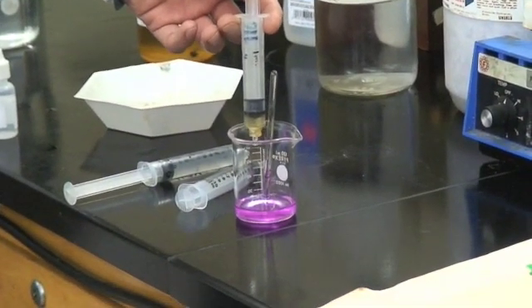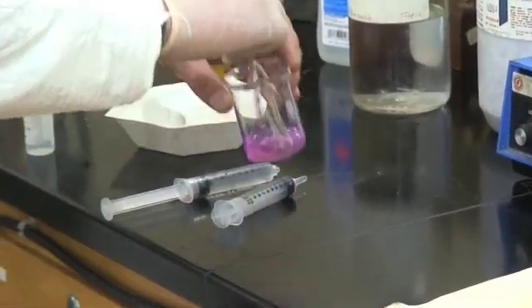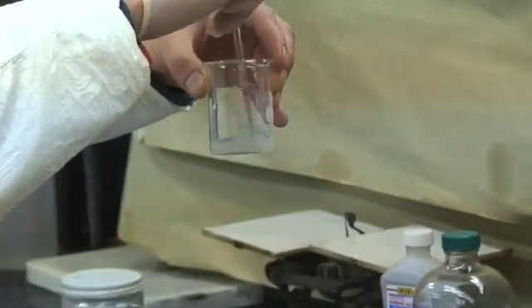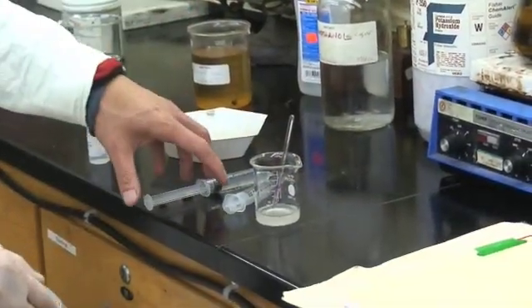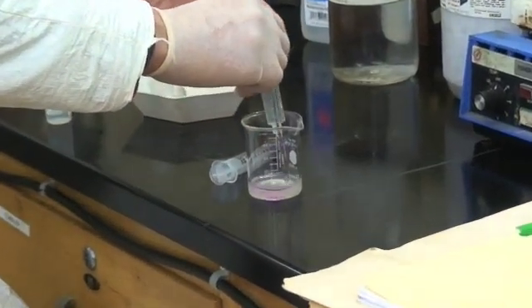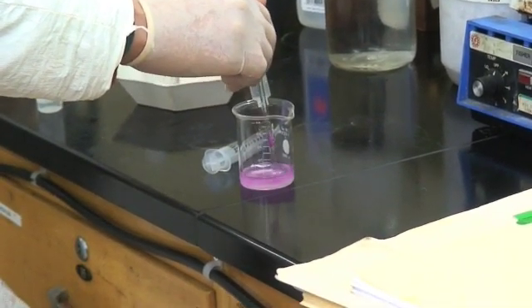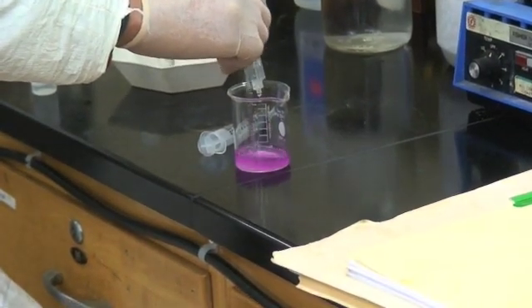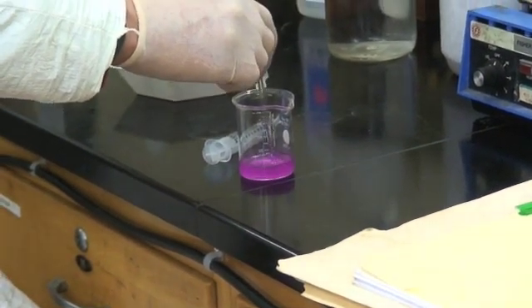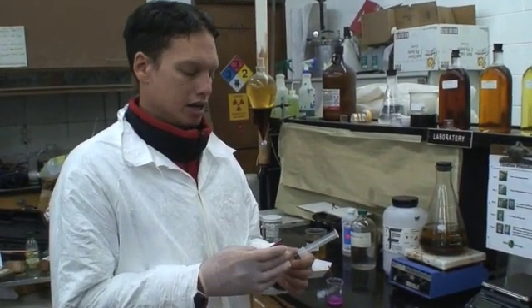Then we're going to add one milliliter of raw oil. Now we slowly drip the KOH solution until the oil turns to a dark purple color. Then we look at our KOH syringe — we used barely maybe 0.5 of a milliliter.